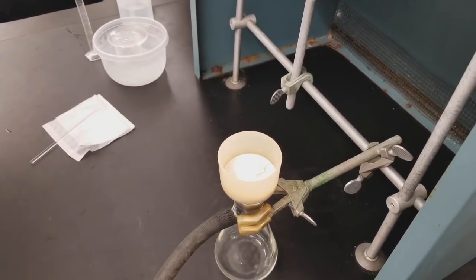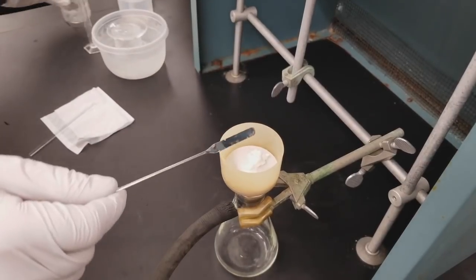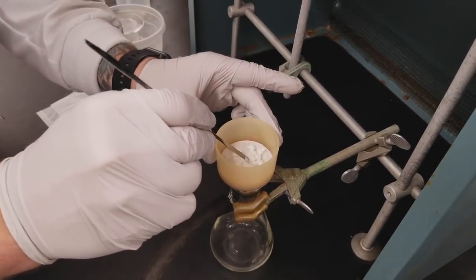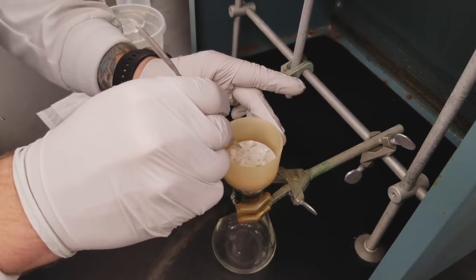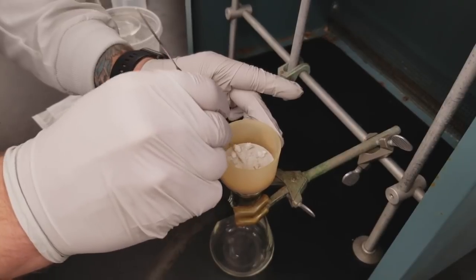You can use a bit of cold water to help transfer any additional remaining solid from the beaker over if necessary. And then you want to spread the solid out so that we can get maximum vacuum through those crystals and get them dried.